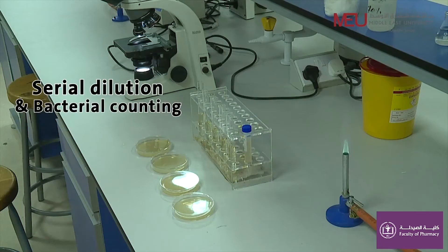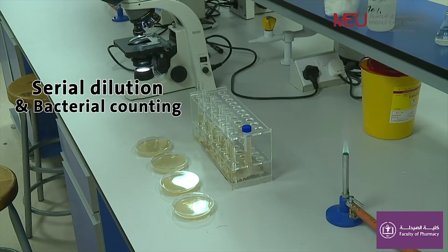Dear students, welcome to the microbiology lab. The experiment aim is to prepare a serial dilution and be able to count bacteria in the original culture.